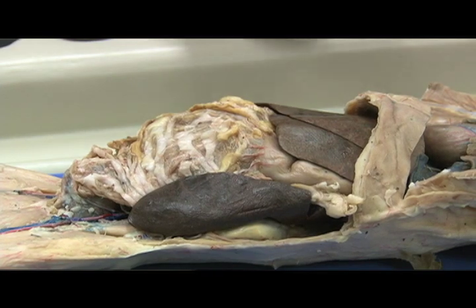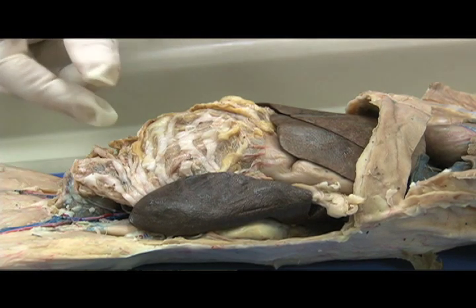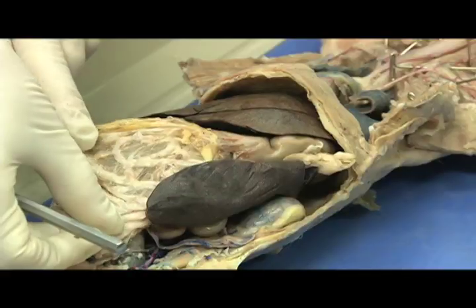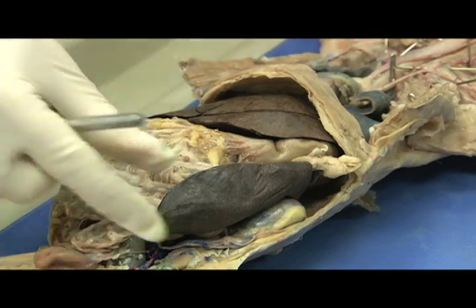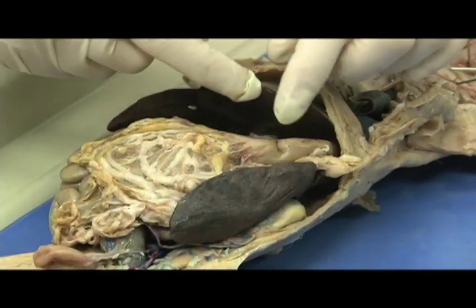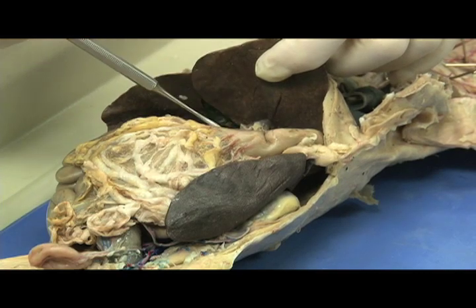Before showing the vessels of the abdomen and the pelvis, let's review the location of the major organs: the liver and gallbladder, the greater omentum, the spleen, and the stomach.